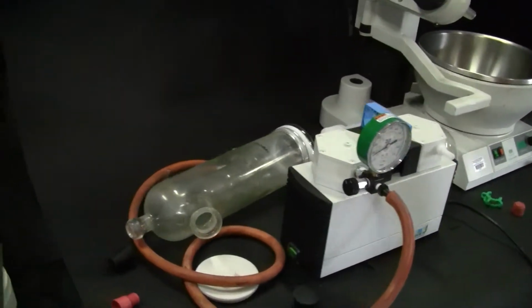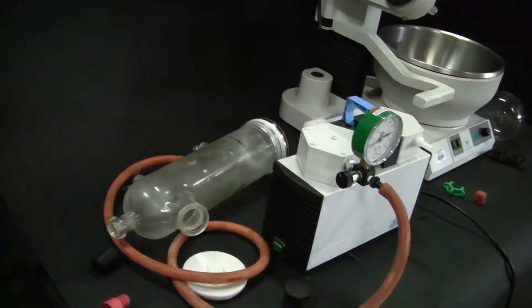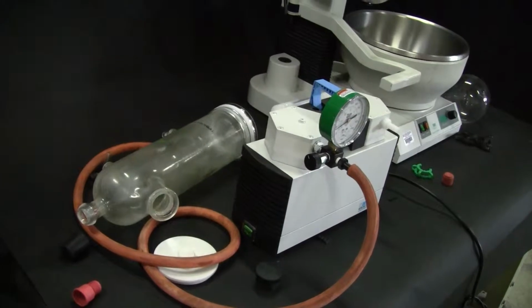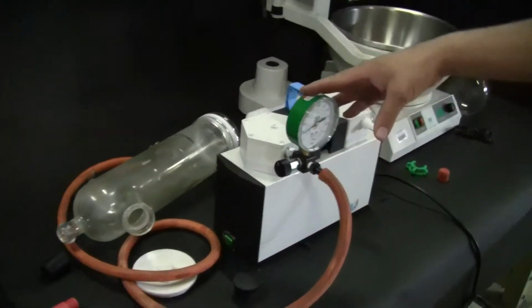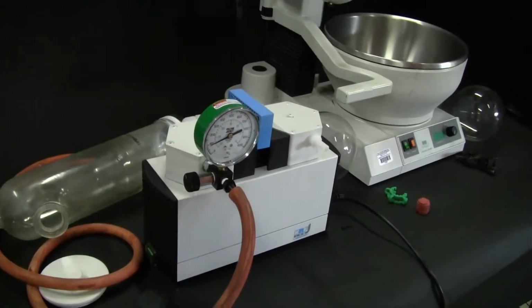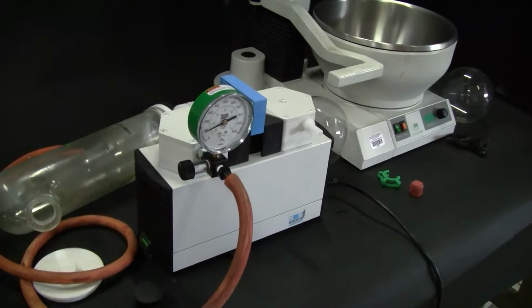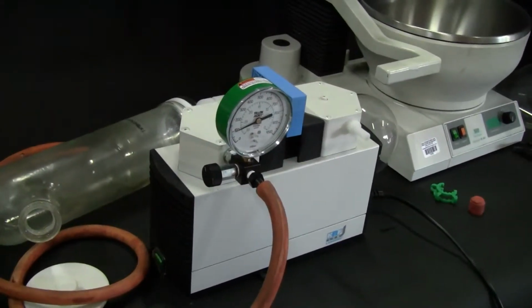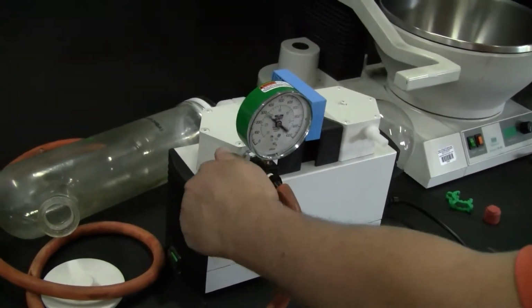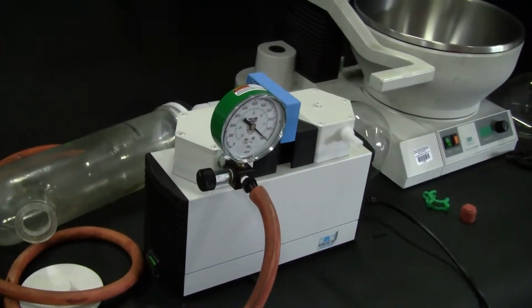So today, the cold trap assembly, turn on the vacuum pump. Again, this is a KNF UN820-3. It's a new vacuum pump with this great new valve gauge system. And what this allows me to do is if I close the system, I know the vacuum pump is 100% working. I can release the vacuum right through this little valve, which makes everything just wonderful.